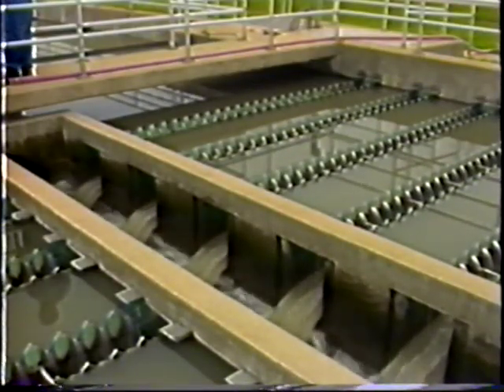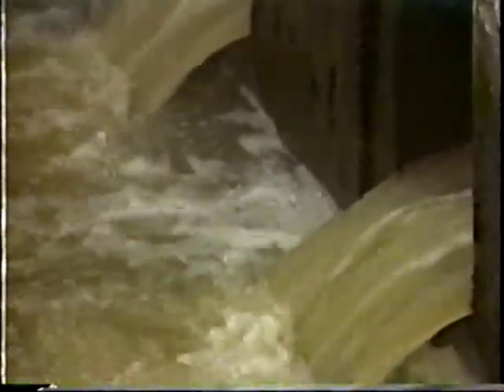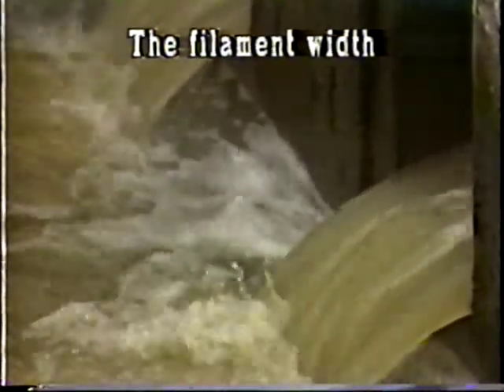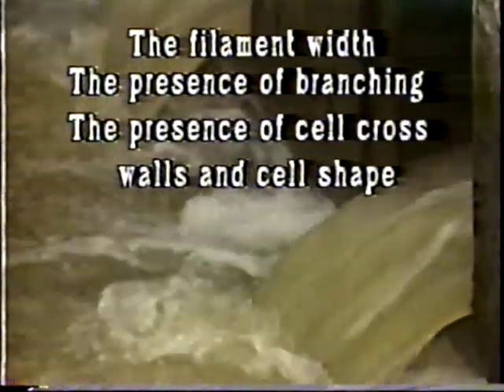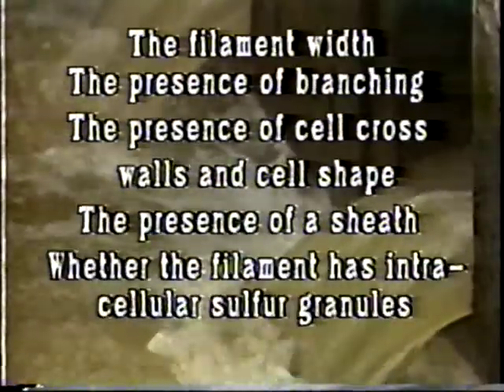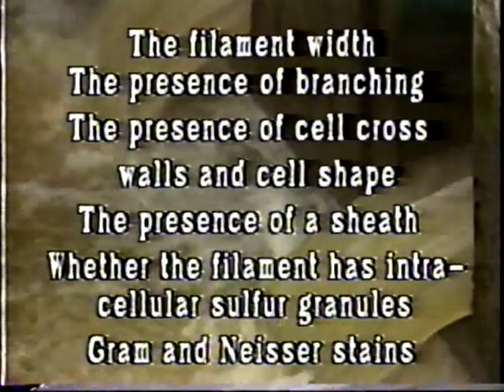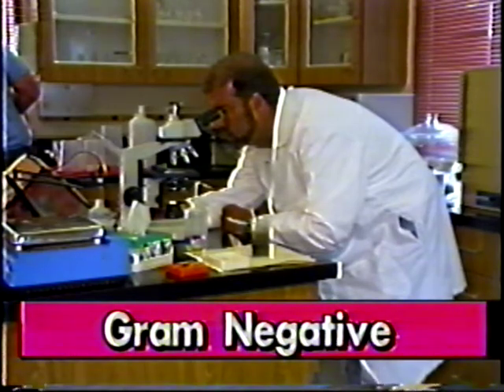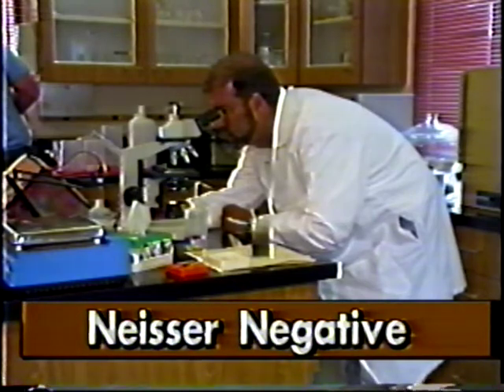The following is a list of important characteristics used to identify filaments. The filament width, important if greater than or less than 1 micrometer. The presence of branching, and if true or false. The presence of cell cross walls and cell shape. The presence of a sheath. Whether the filament has intracellular sulfur granules. The Gram and Neisser staining reaction. The Gram positive is blue, the Gram negative is red, while the Neisser positive is purple and the Neisser negative is brown.